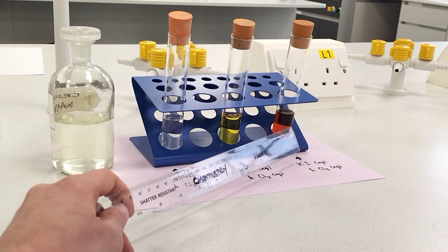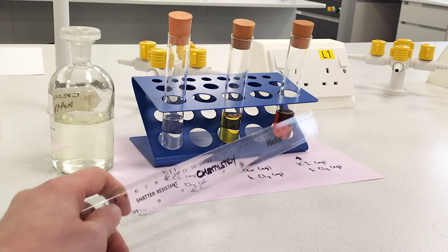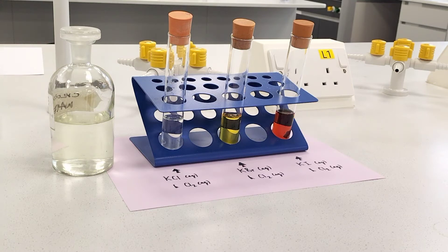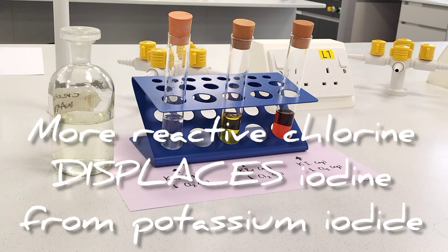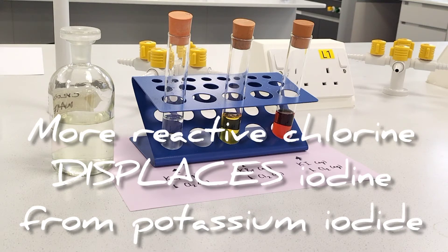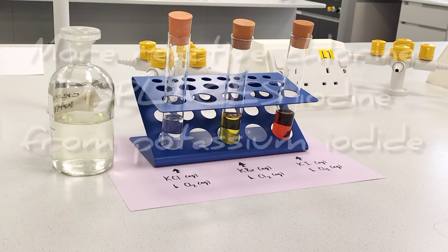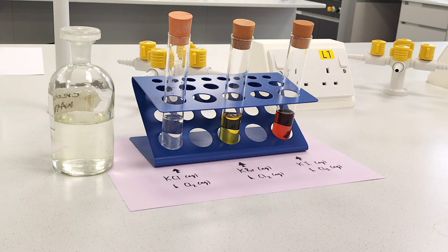On the far right hand side, I added chlorine water to potassium iodide, and a reddish brown colour has appeared. That is again indicative of a displacement reaction — the more reactive chlorine has displaced iodine from the potassium iodide solution, because chlorine is more reactive than iodine. We now have molecular iodine, I2, dissolved in the water, and dilute iodine has a brown appearance.